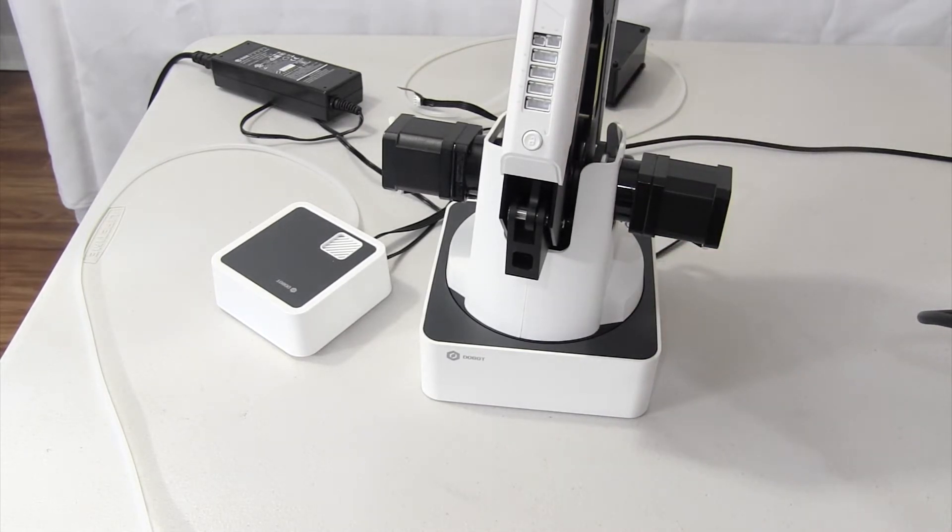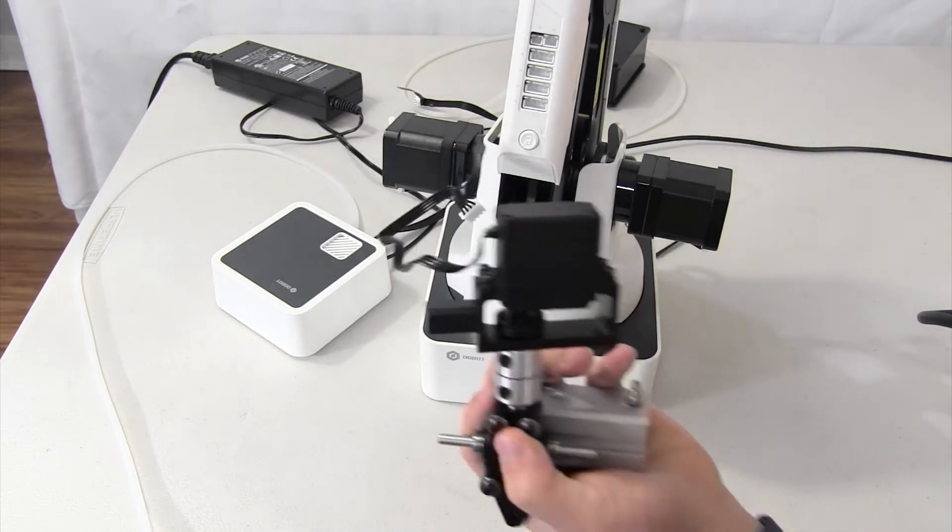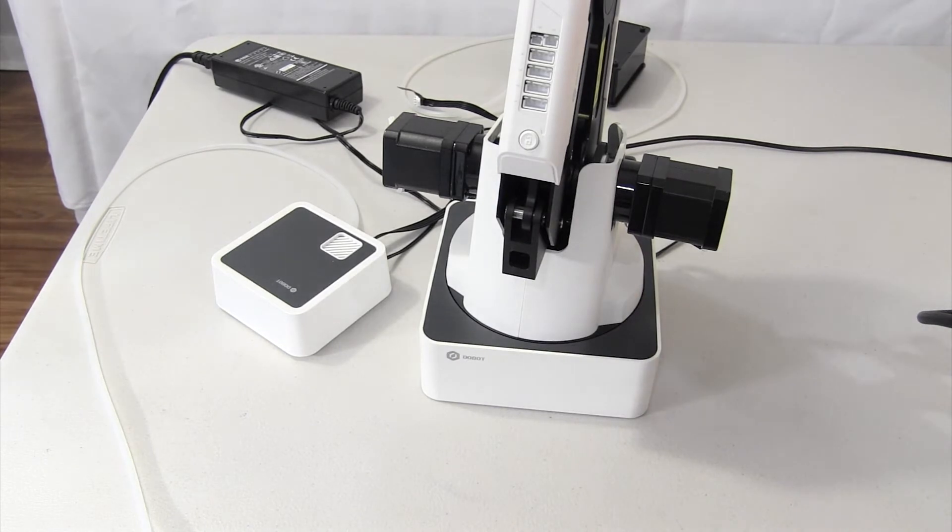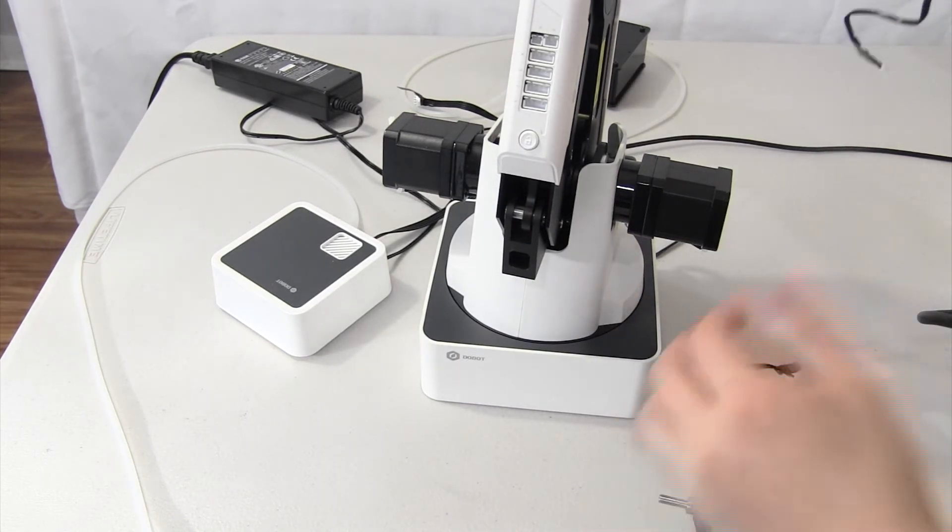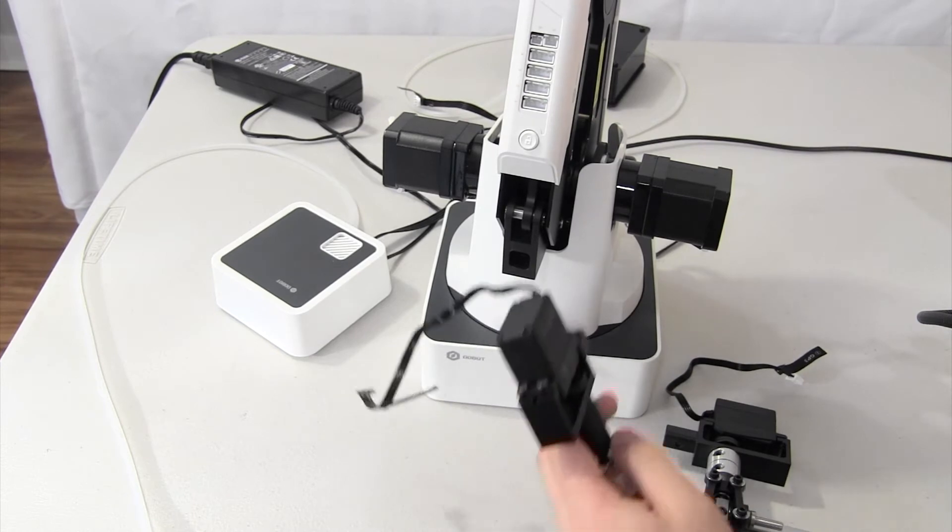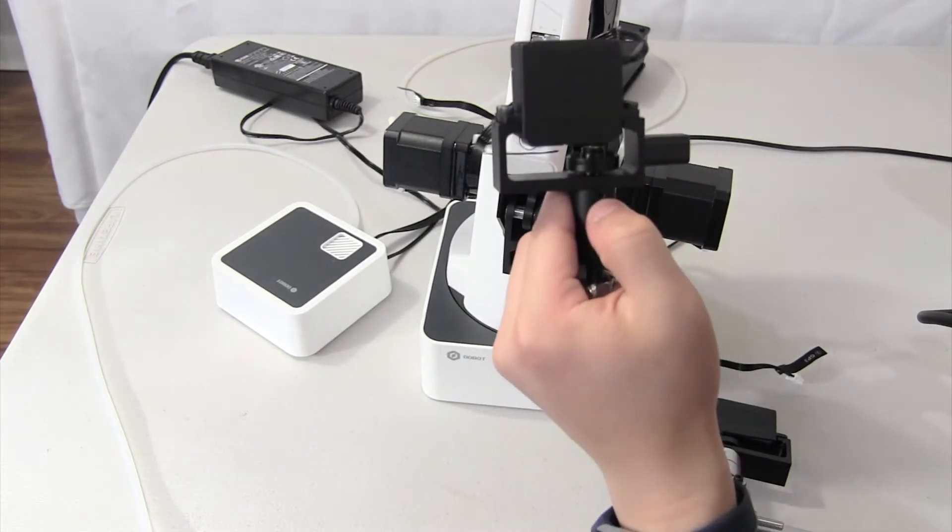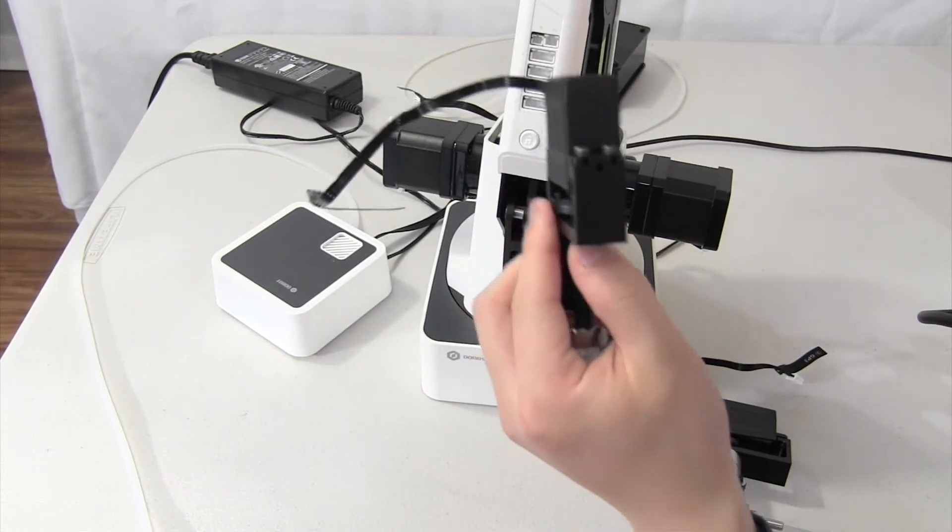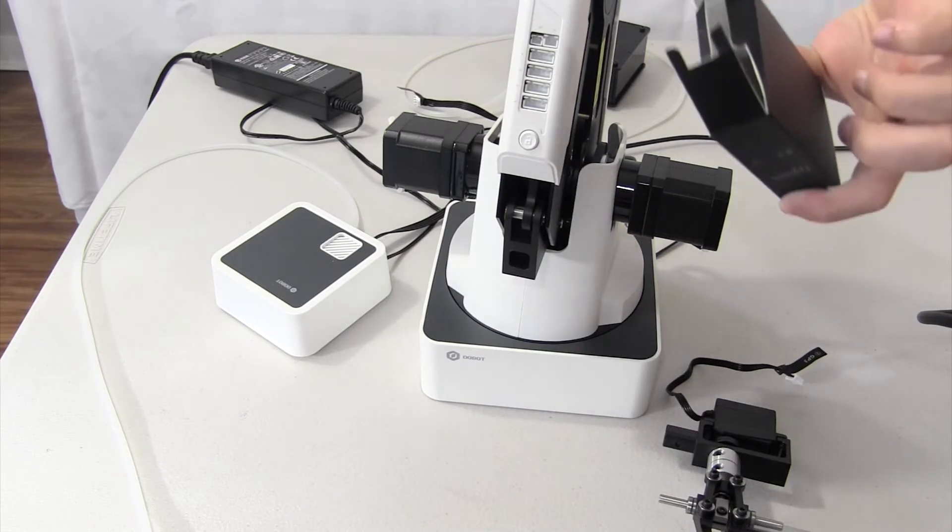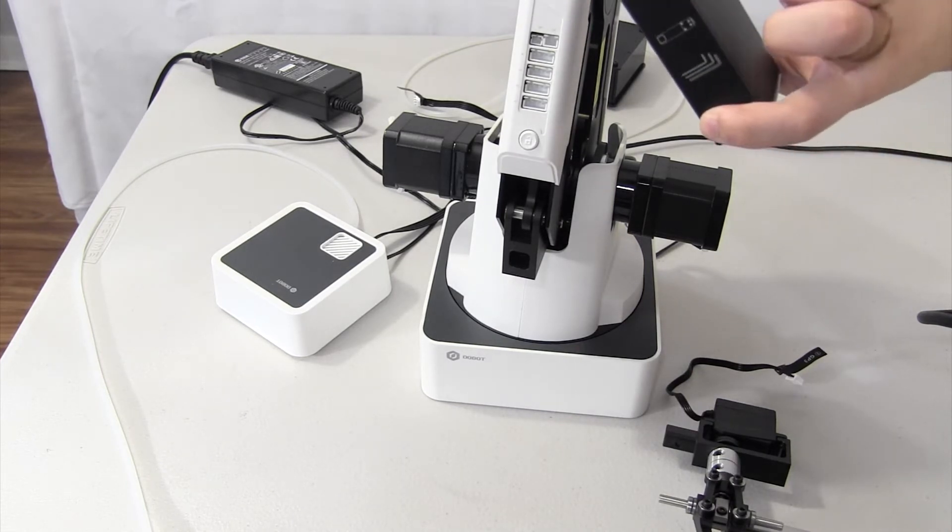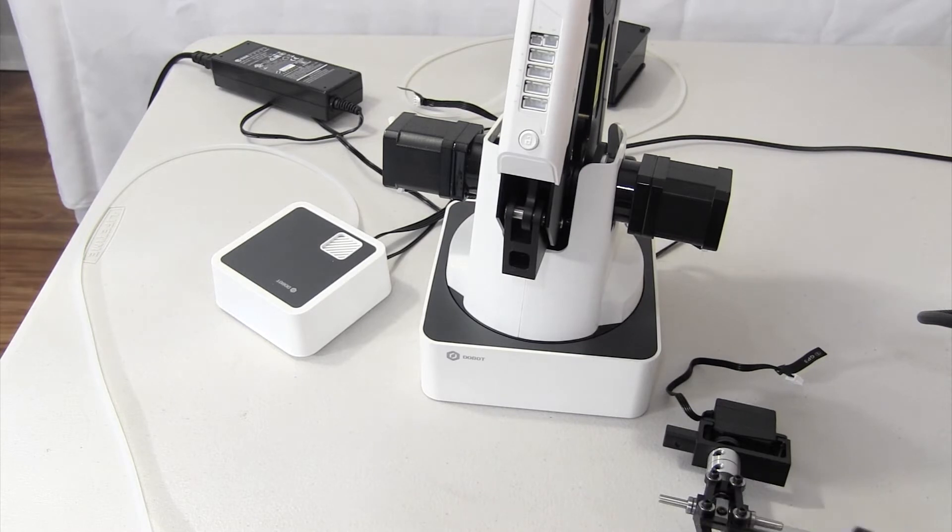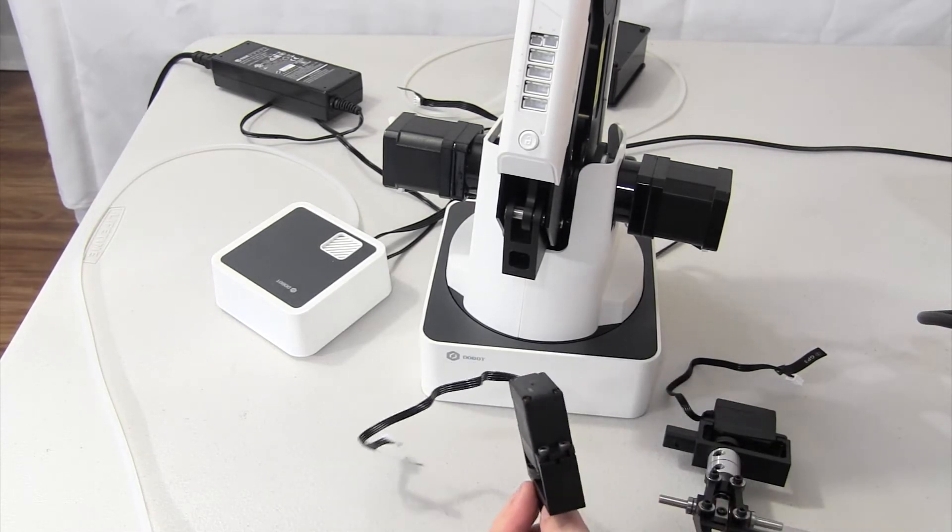What you should end up with, here I'm getting it out, you should get something like this. And in order to do it, first of all, you want to look at here, there's a screw right there and there's a screw right there. There should be a box that looks something like this and you want to take out the screwdriver, one of them, and take out that screw.